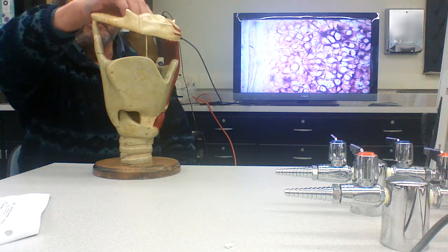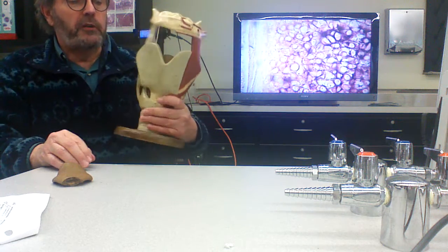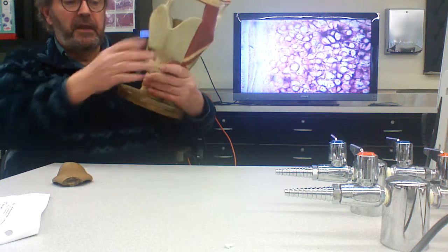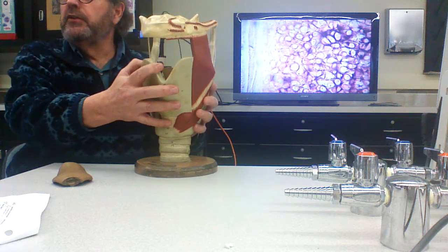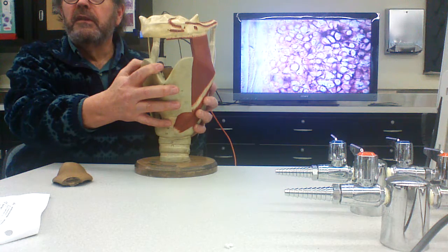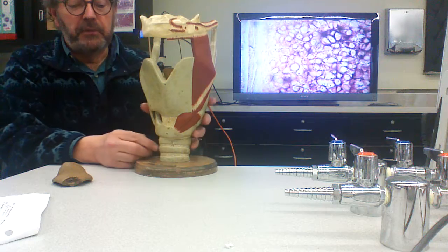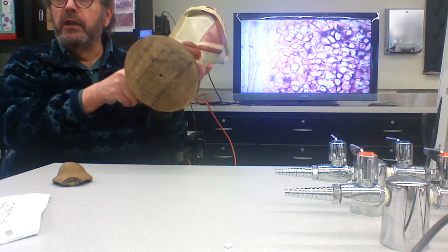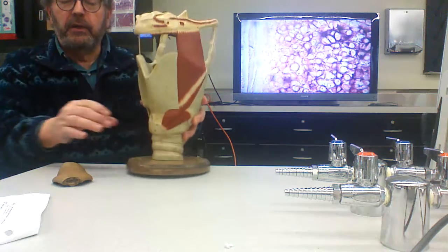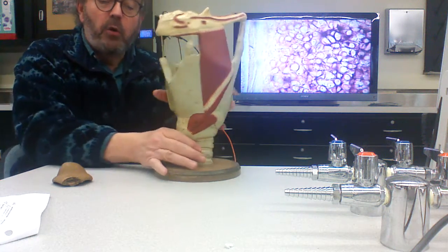Those were the days. By the way, this is, of course, the larynx, right? And the larynx, the skeleton of the larynx, is made out of hyaline cartilage. And it's basically developed cartilage C-rings from the trachea. And here are the trachea C-rings, right? They're called C-rings because they're not complete circles, right? And they go around.